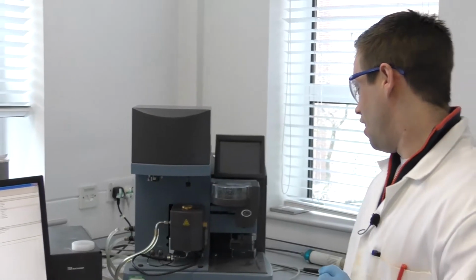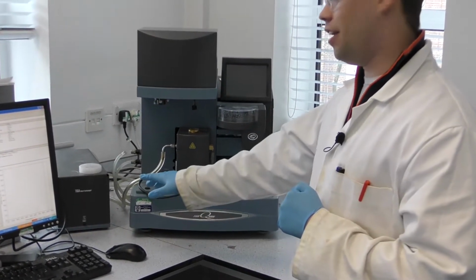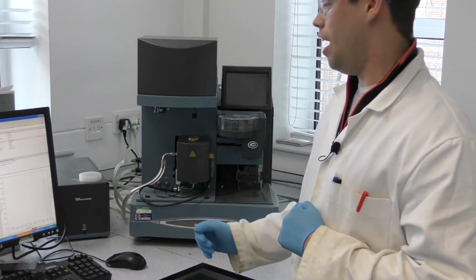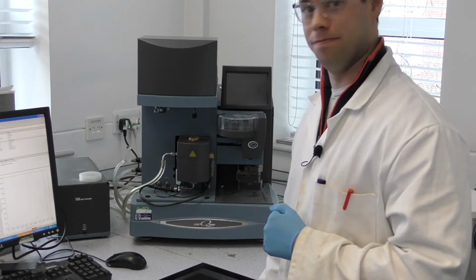Hello and welcome to this short instructional video on the use of the TGA. This machine is a TGA Q5000. Along with that, there are three main components: the TGA heat exchanger, the furnace and the auto sampler. This is connected to a computer and the computer runs the software that runs the machine.